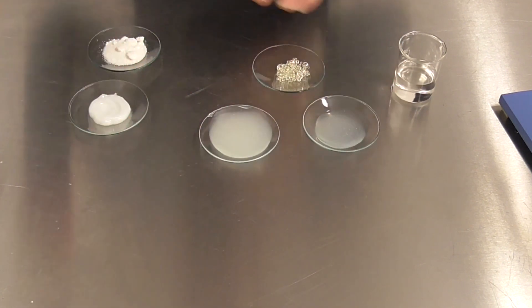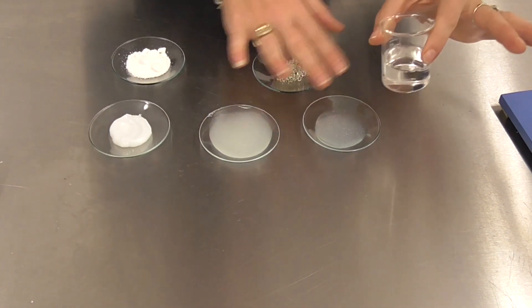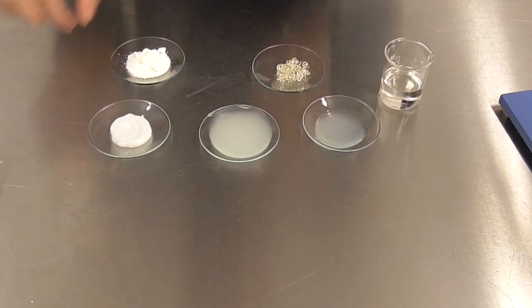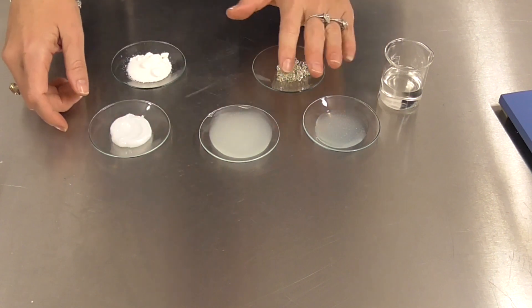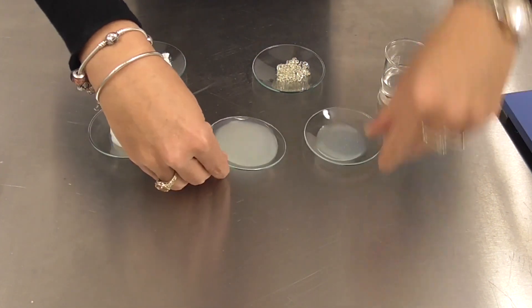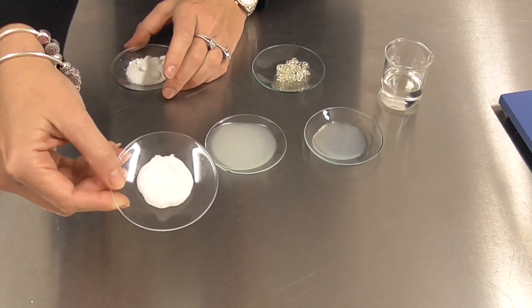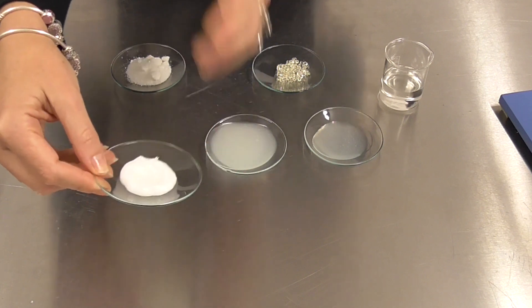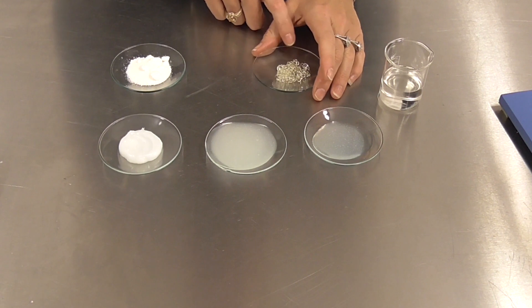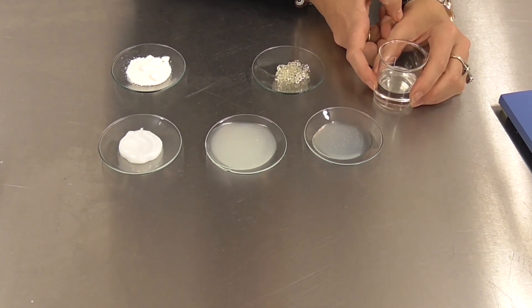While I prepare those, I'm also going to show you this same oil mixture used across all three of these examples. I'm just using different viscosity modifiers, so you can see the effects they have not only on the viscosity of the end product but also the appearance of the end product. And this is just hydrogenated vegetable oil — so again, these are more natural products. The polyamide of course is not natural, but my oil blend is a very natural starting oil blend.